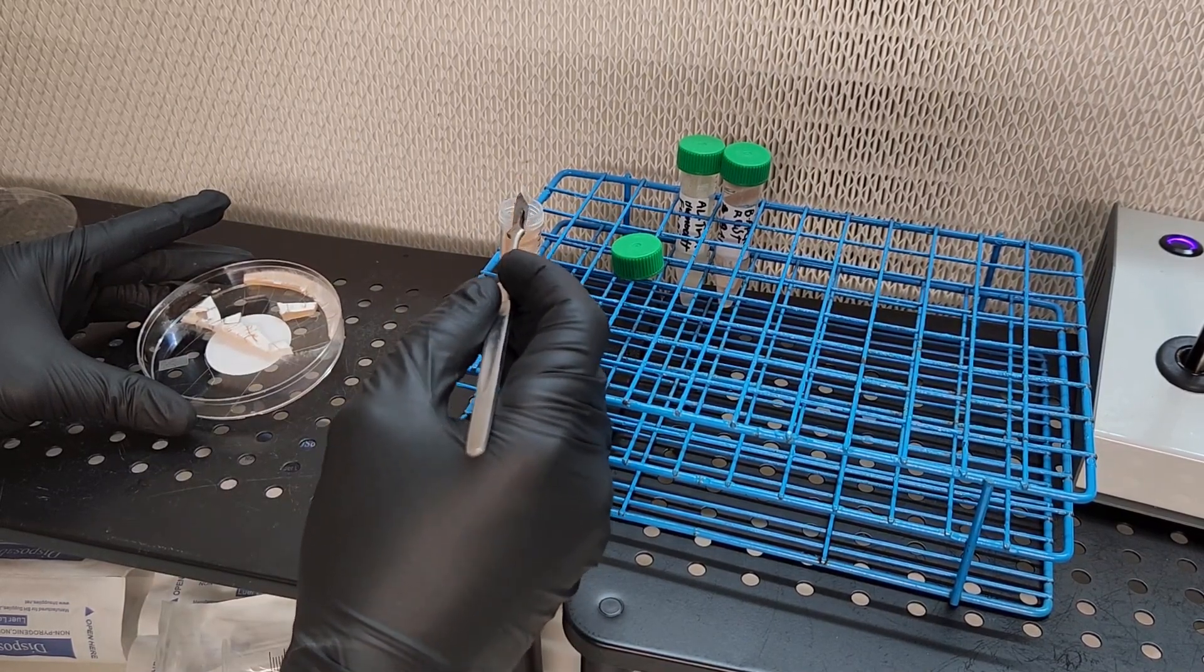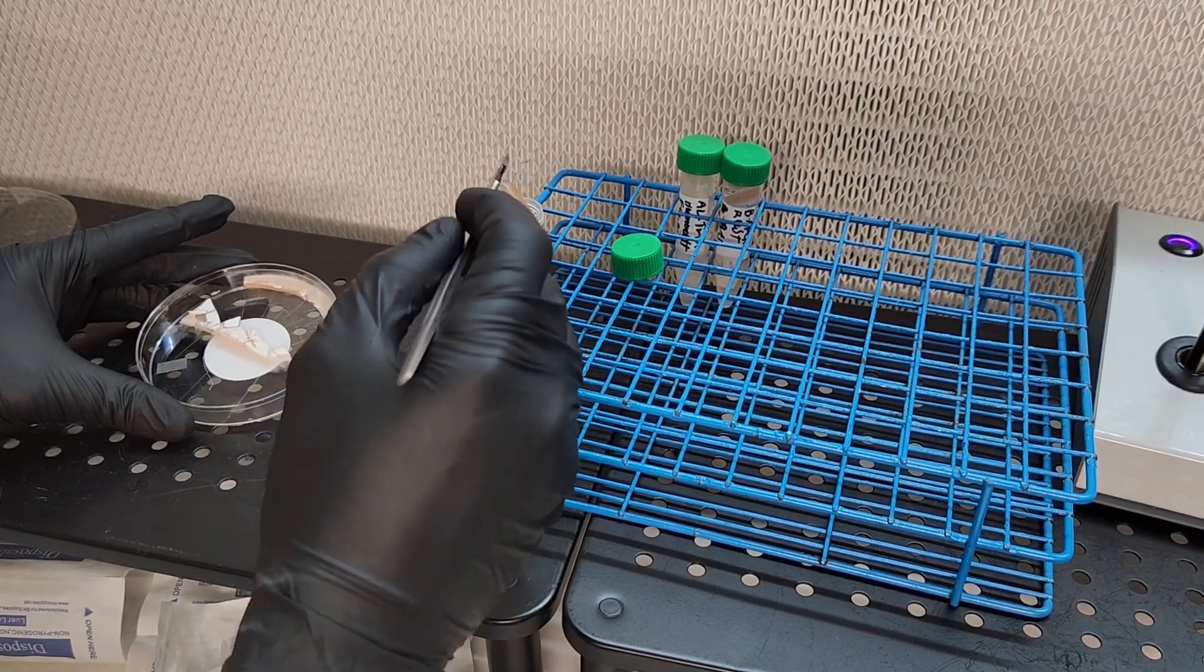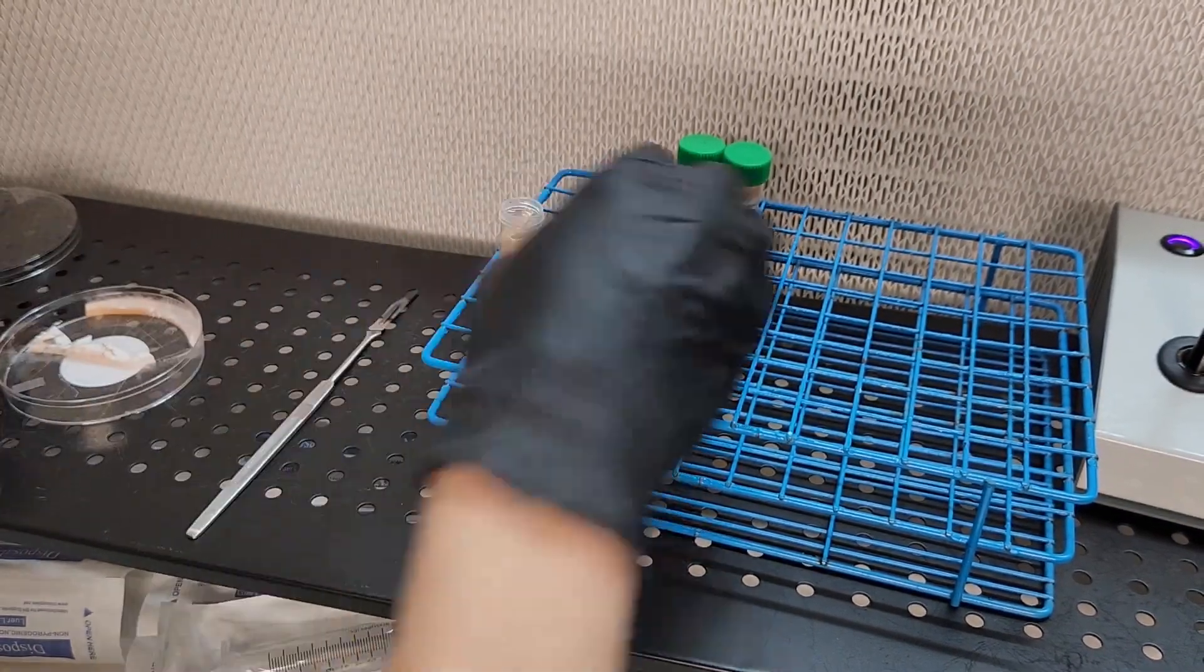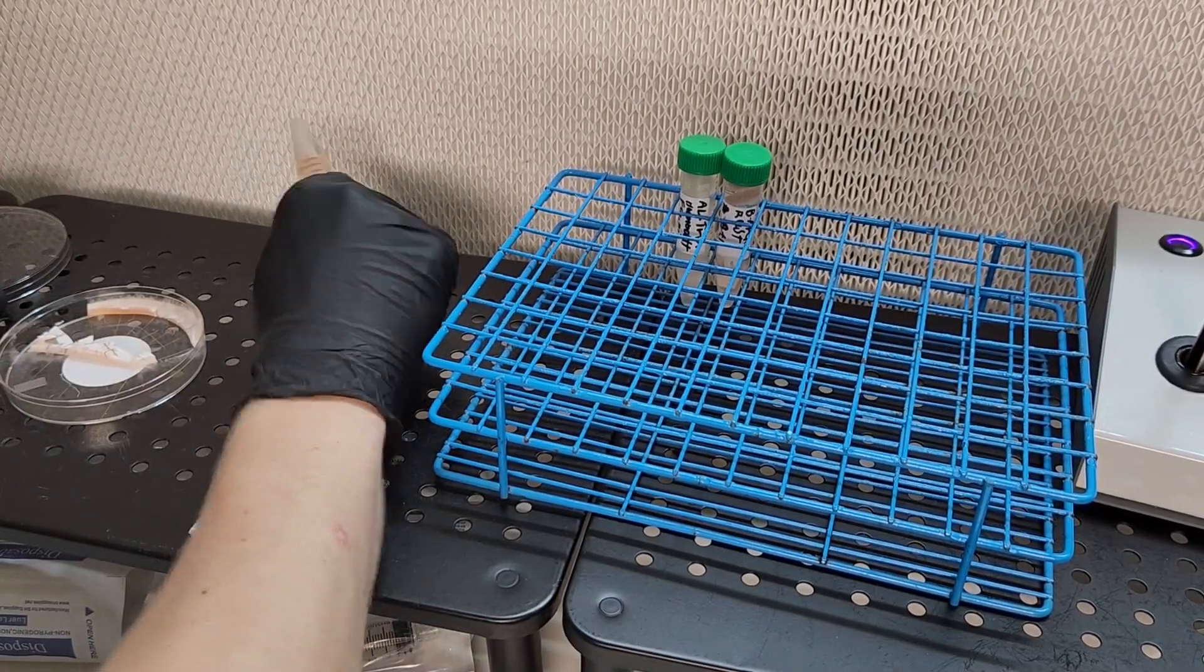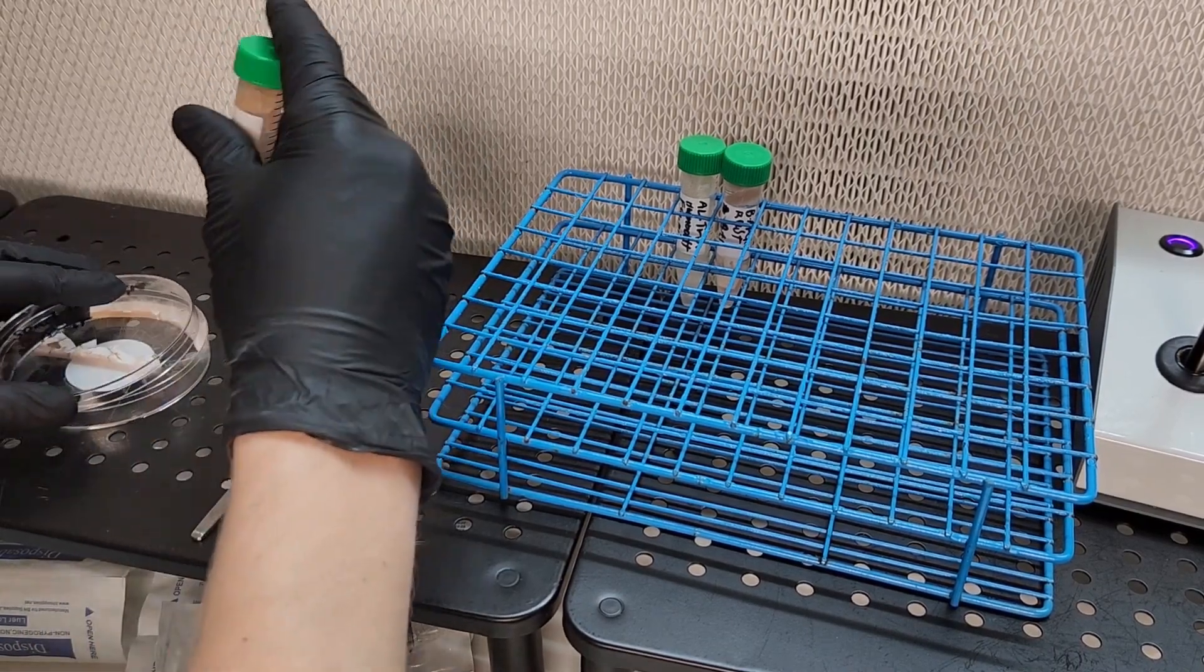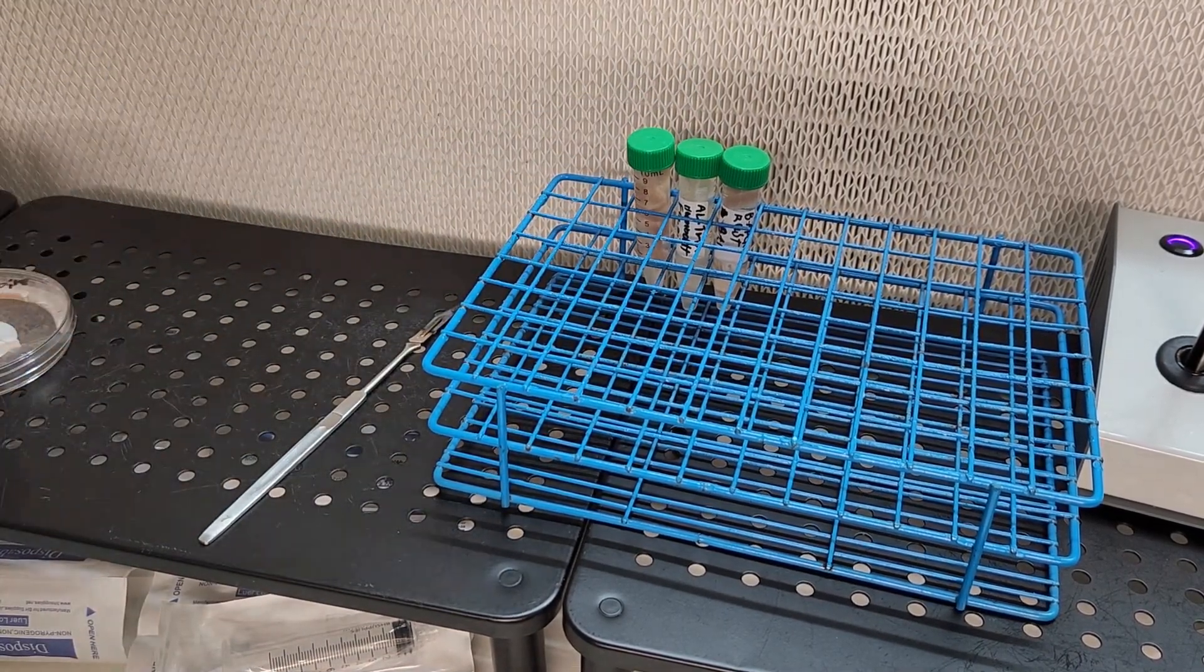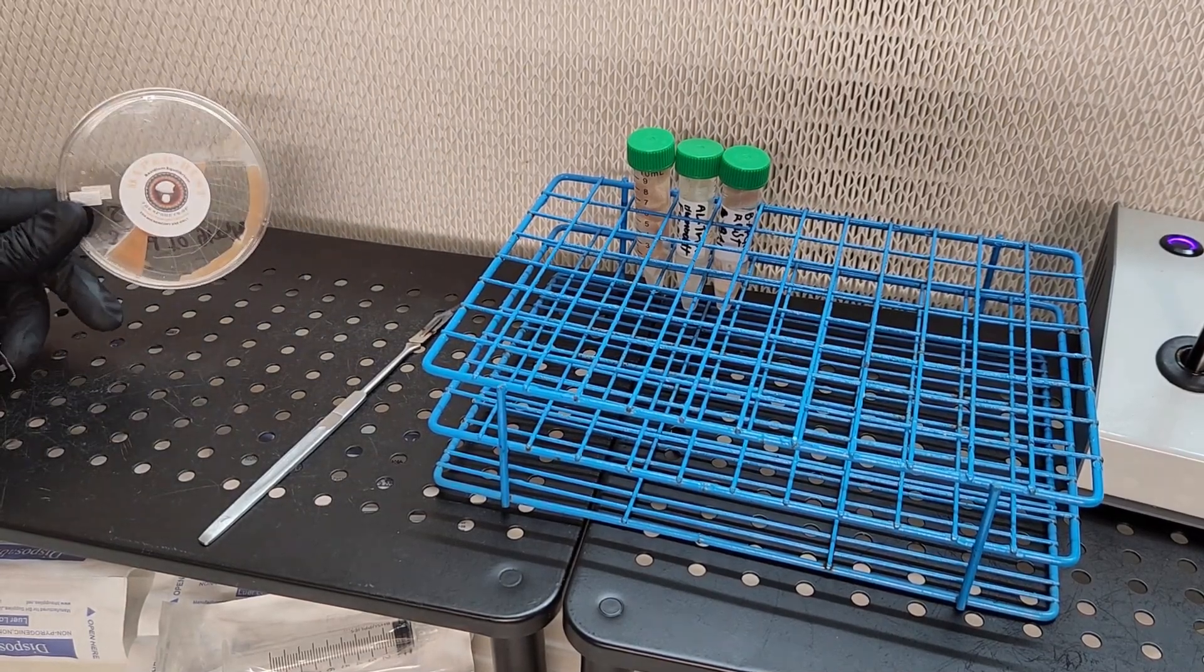After you're done, just screw the cap on nice and tight and shake it up. I like to bang it on something or flick it in order to get the transfers to all suspend evenly so they're not bunched up together and they're all in water with no pockets of air.